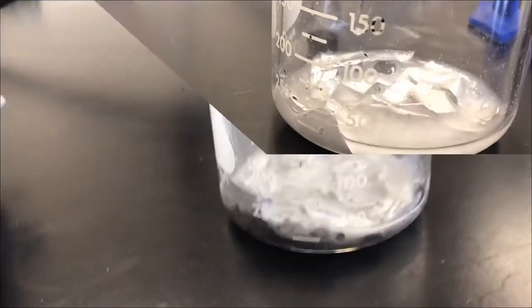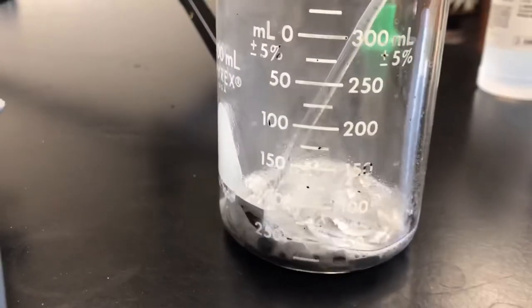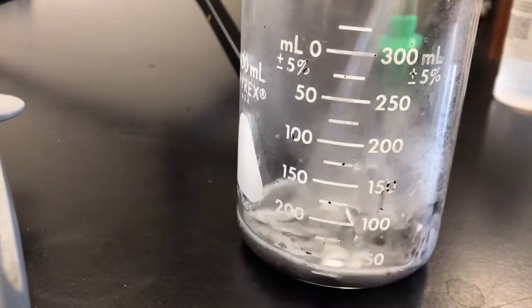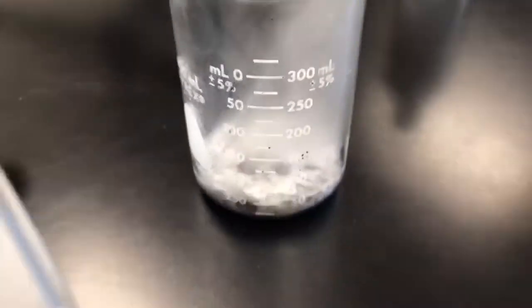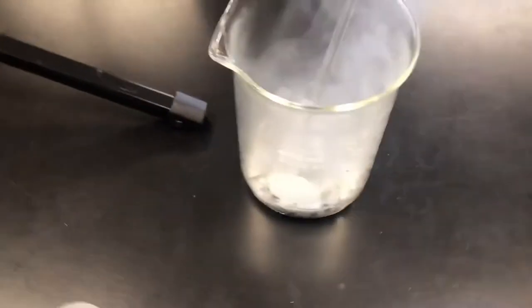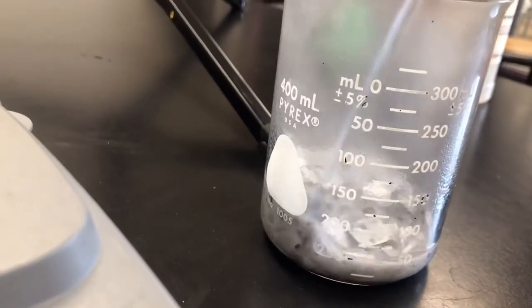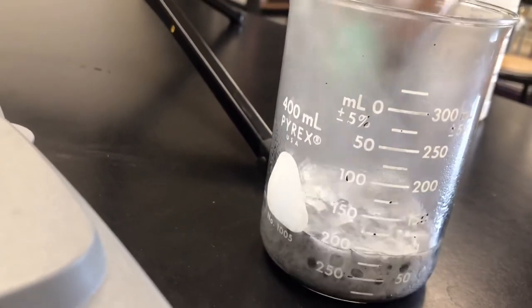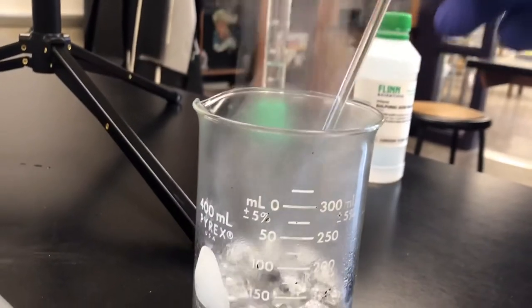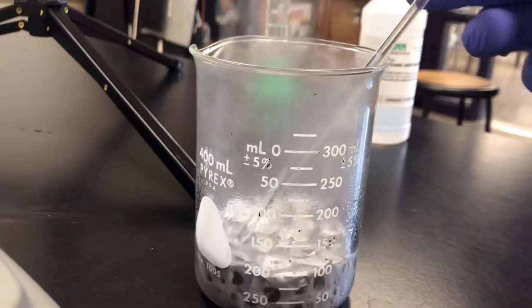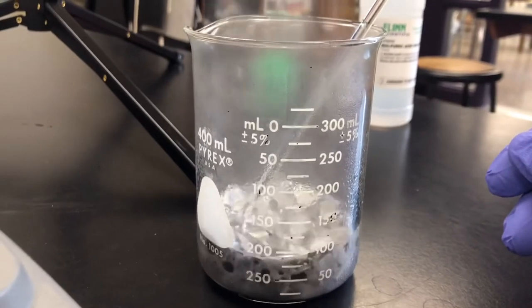At this point you see we have a very strong reaction occurring. Now you wouldn't put your face over this, but I can put the camera over it. A strong smell, very vigorous. A lot of steam coming out of this. So it is hot.